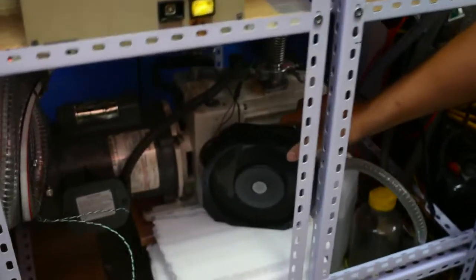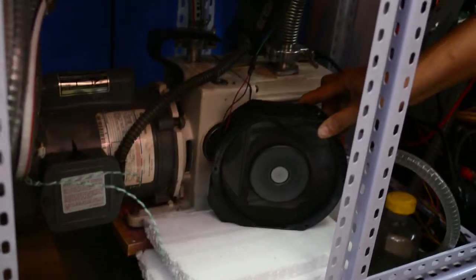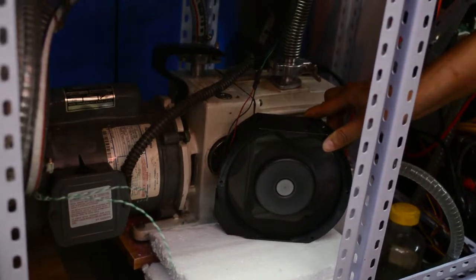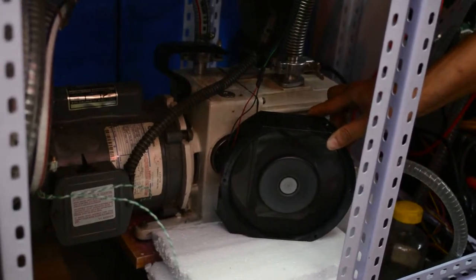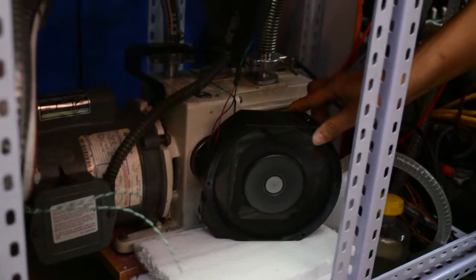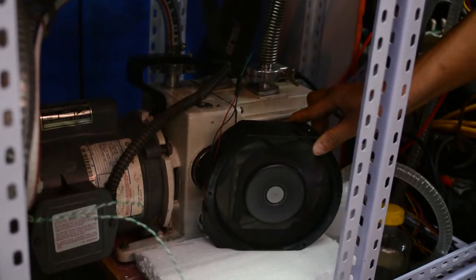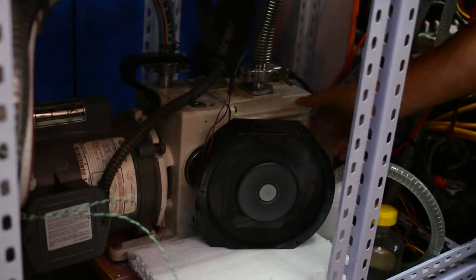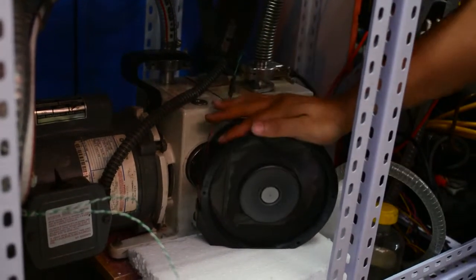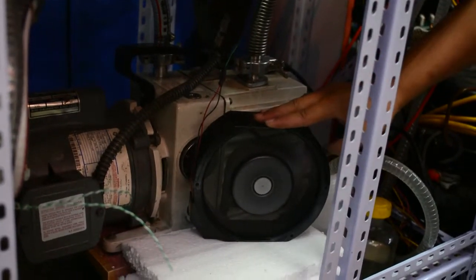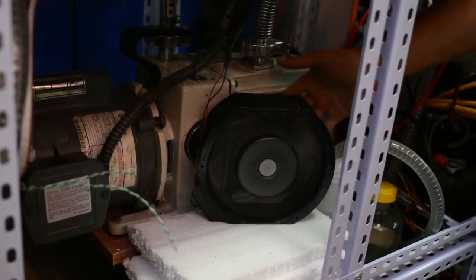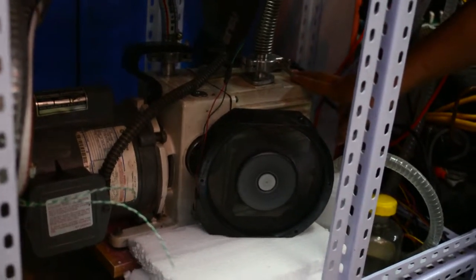This is a fan I took out from an old-school Tektronix oscilloscope, maybe a TDS754D. This fan is working well. It is used 24V DC. It is quite quiet and it is a lot of air flow through this mechanical pump.